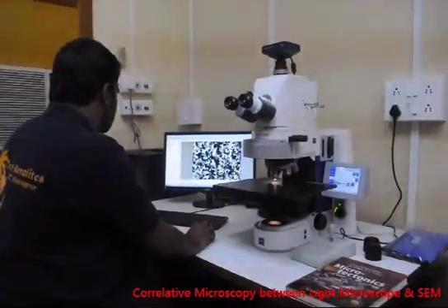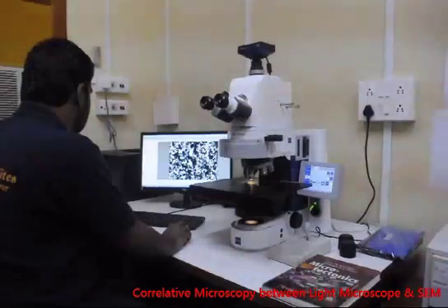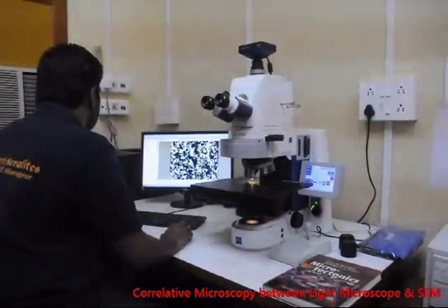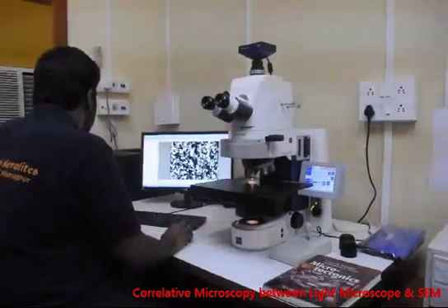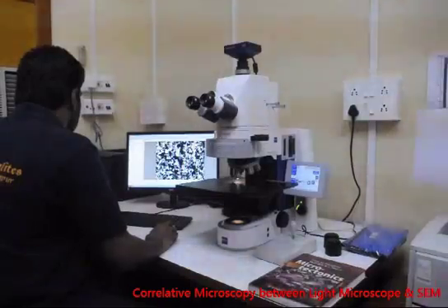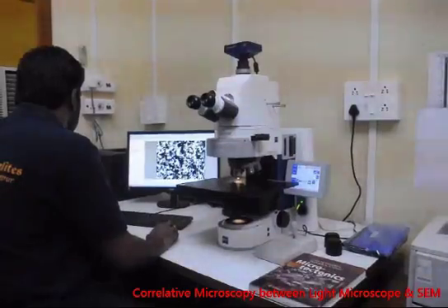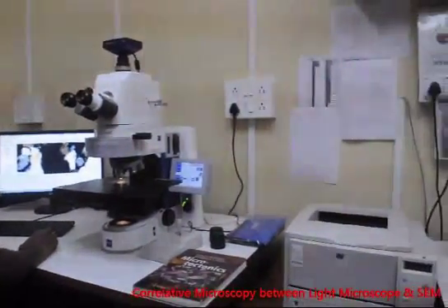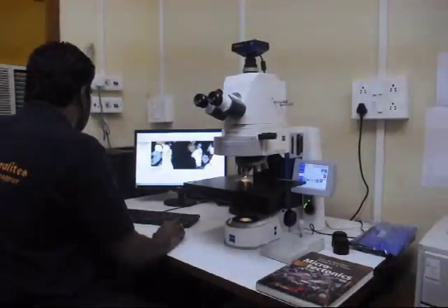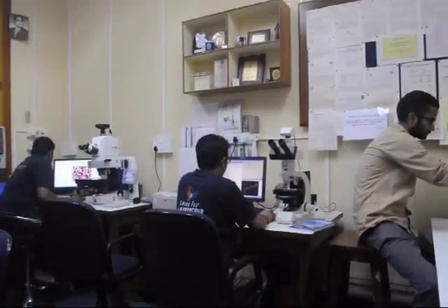This microscope also comes with a correlative microscopy holder, which enables shuttle-and-find between this light microscope and the scanning electron microscope housed in the central research facility at IIT Kharagpur. This is the Fabric Analysis Laboratory with all these instruments.